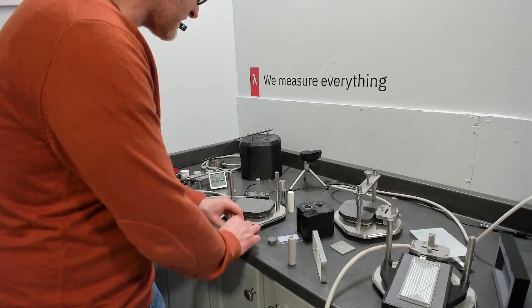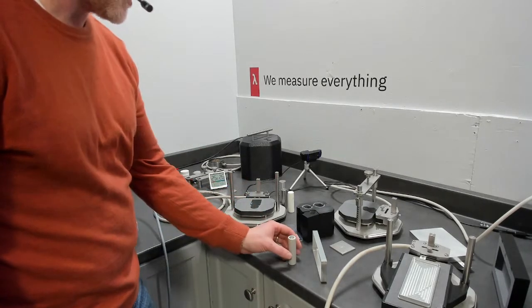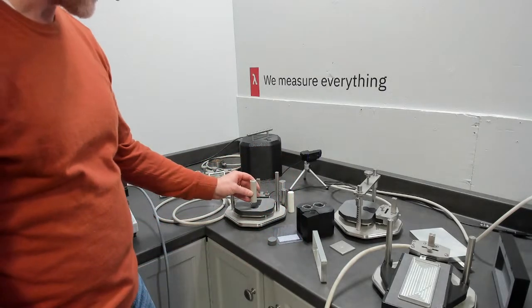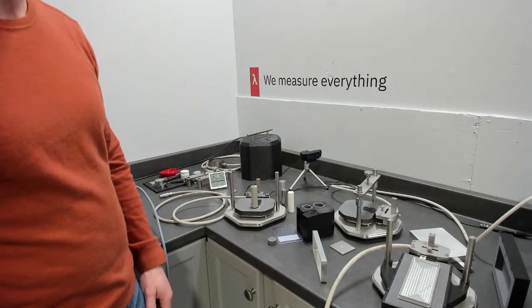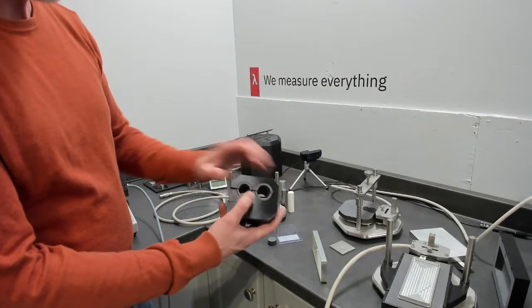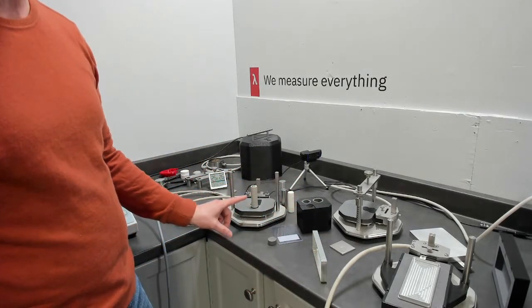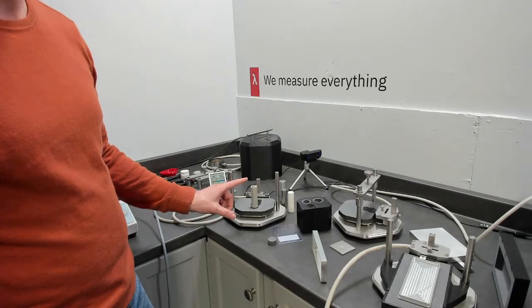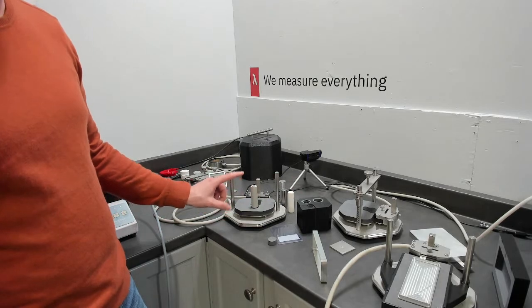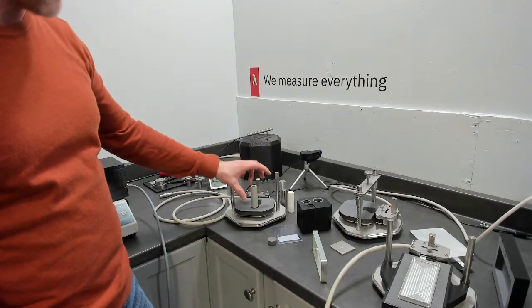My experimental setup would have the sensor installed, and we would directly connect the sensor to the underside of the cylinder, and insulate it with the other smaller dimension, looking at the heat propagation along the length of the cylinder. That's a very high confidence thermal conductivity. Of course, you'll get an average of the jelly roll, an average along the length.